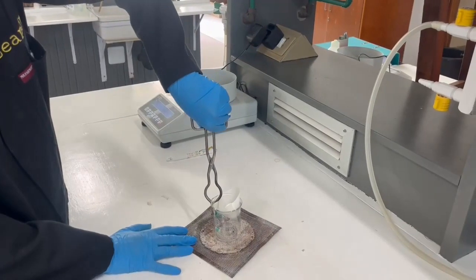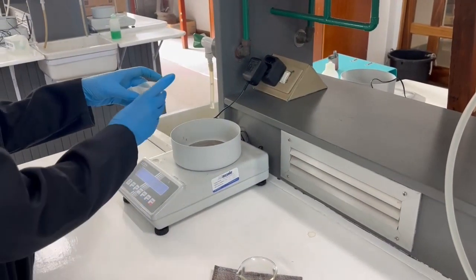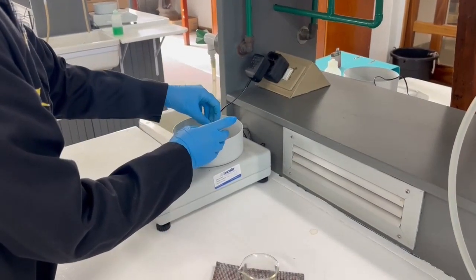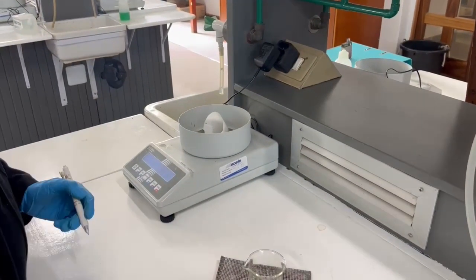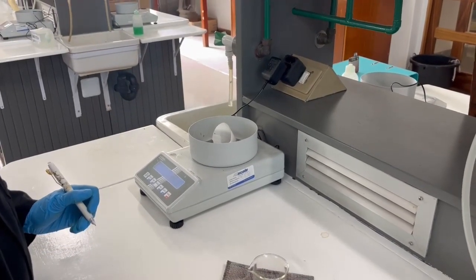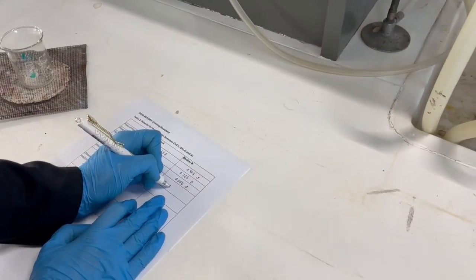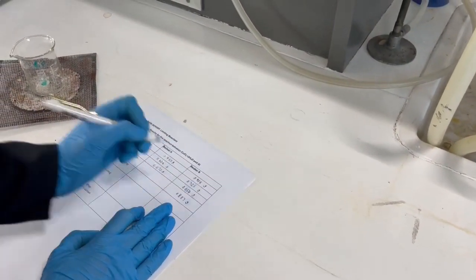Using tongs, remove the beakers and place them on a metal gauze and wait for them to cool. Once the filter papers are cool to touch, weigh the filter papers with their contents and record these masses in the data report table. Discard the filter papers and copper in the waste container for solids that is supplied, and pour your liquid into the supplied waste bottle.